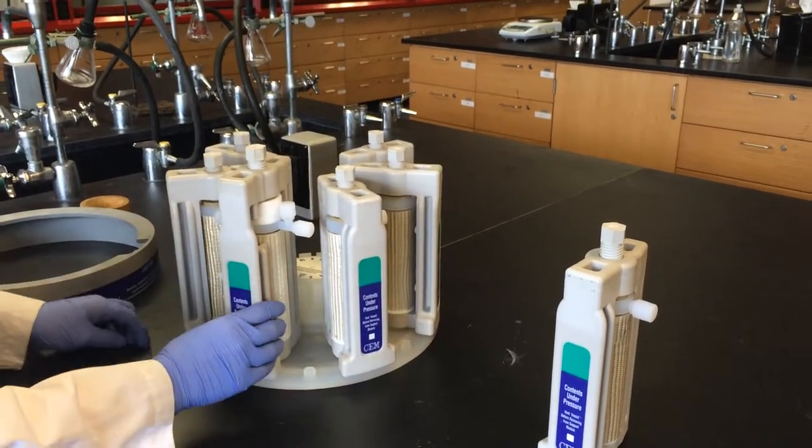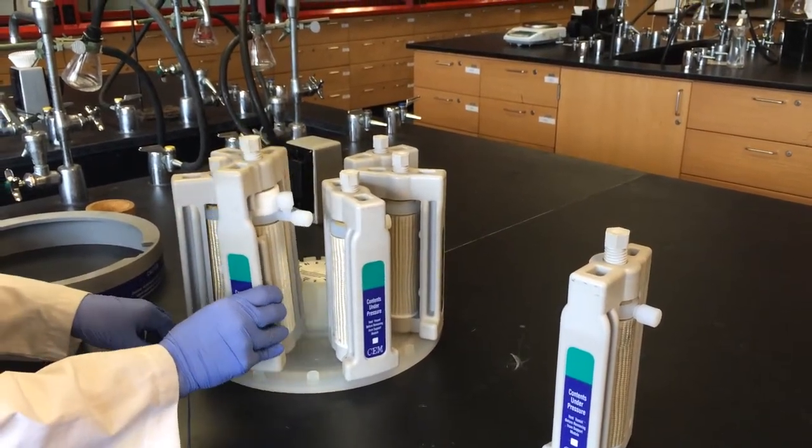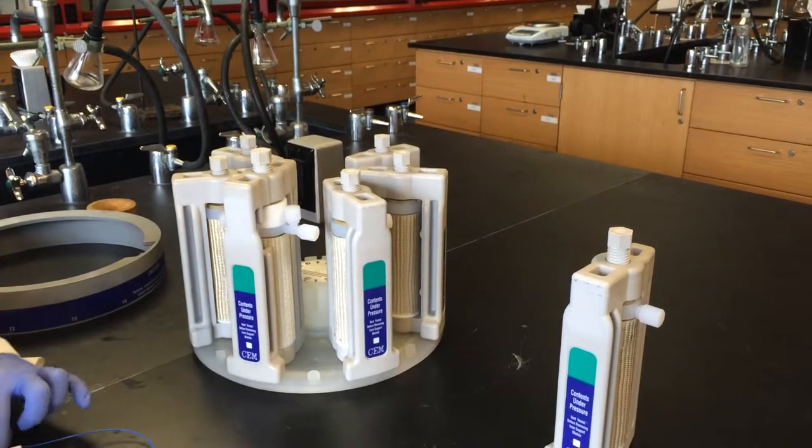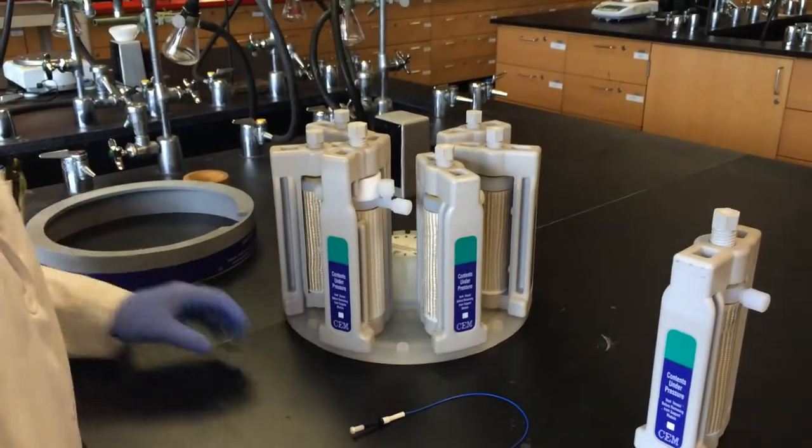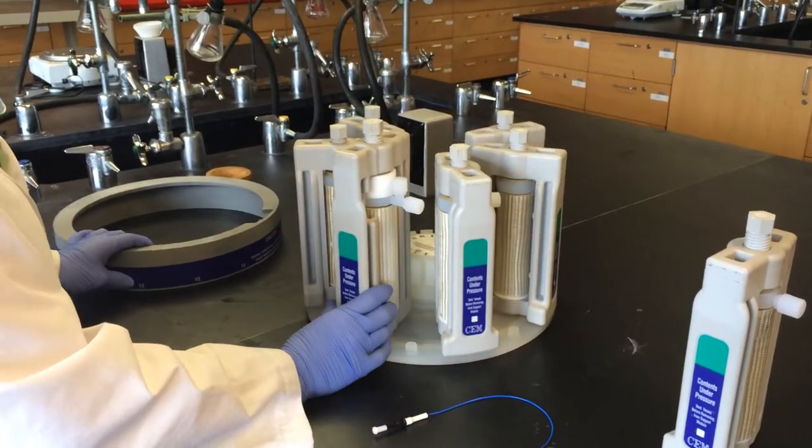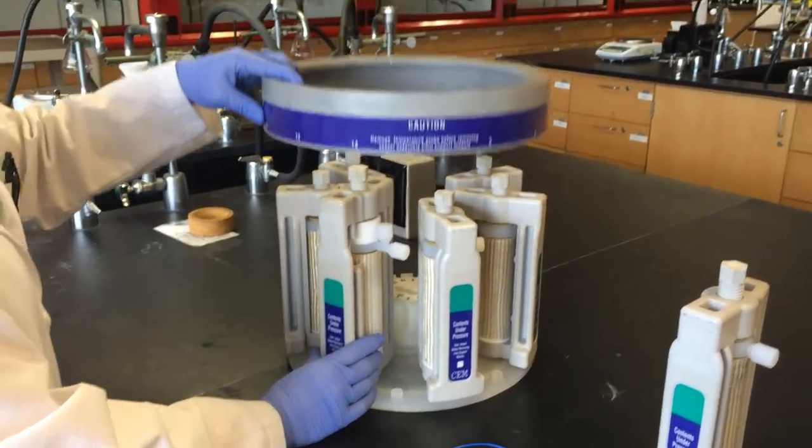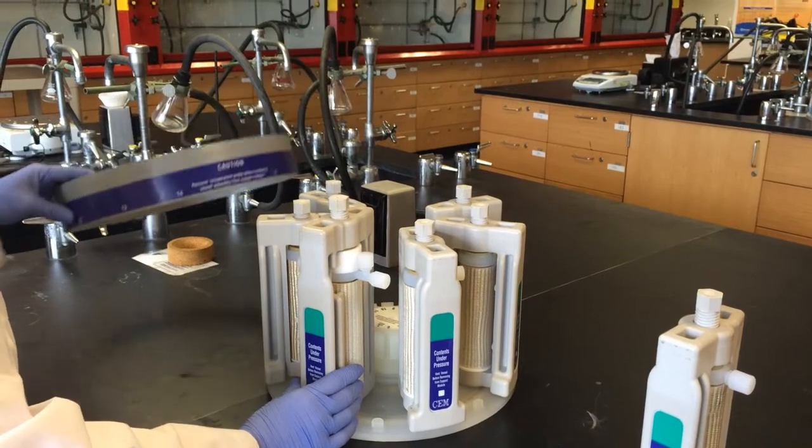The tallest one here is the control vessel, which records the temperature using this probe. Once all of the support modules are on the carousel, this ring is placed on top to hold each of the support modules in place.